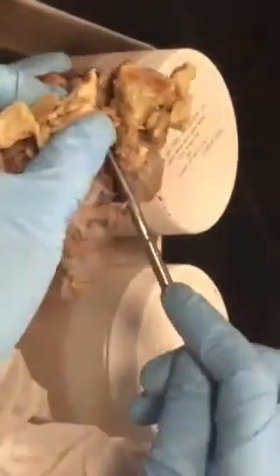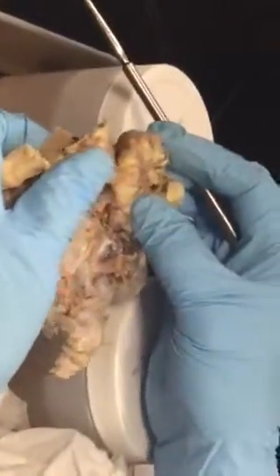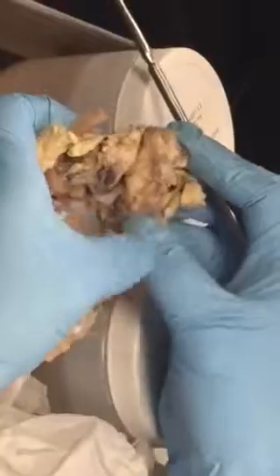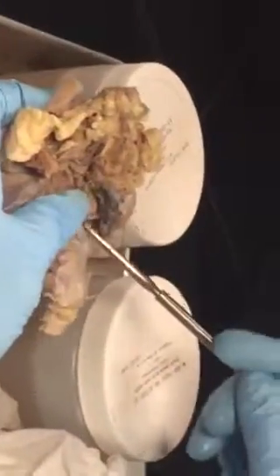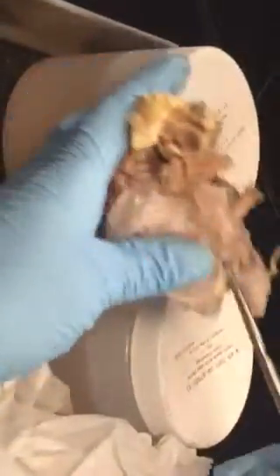And then the optic chiasm. Yeah, optic chiasma is here, right? Does it make sense? Yes. And that's anterior to the pituitary gland. Okay. Now, let's turn around again because I already flipped it over. So before that, you can still see this.